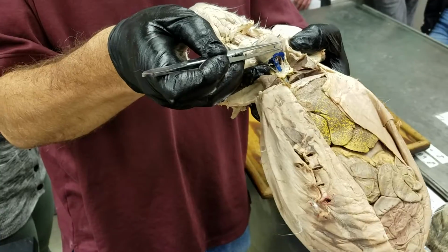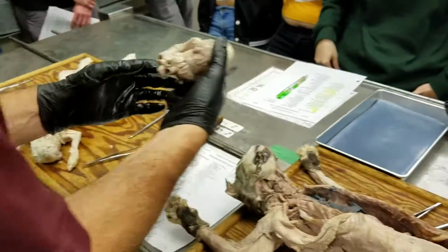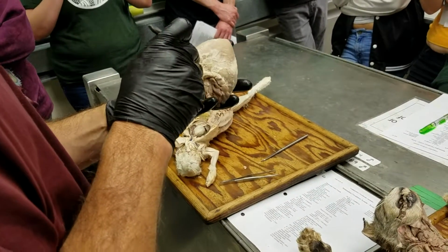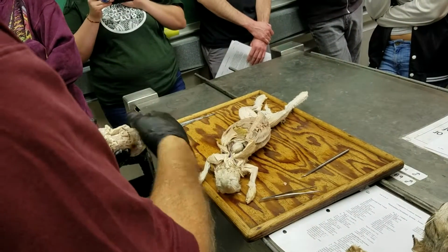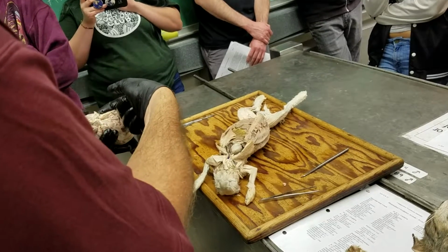Okay. You see that? And then in a cat or a sheep or a human, same thing. On these guys, there is no left cranial vena cava, but there still is a little chamber on the backside of the heart, dorsal surface of the heart, between the atria and the ventricles, running across here, and that's called the coronary sinus.